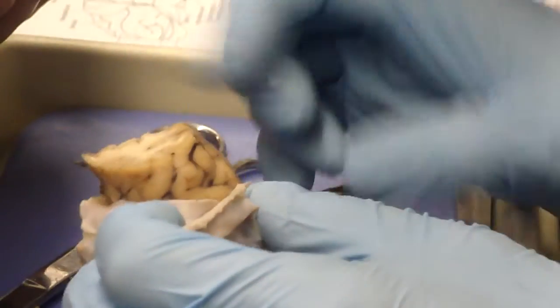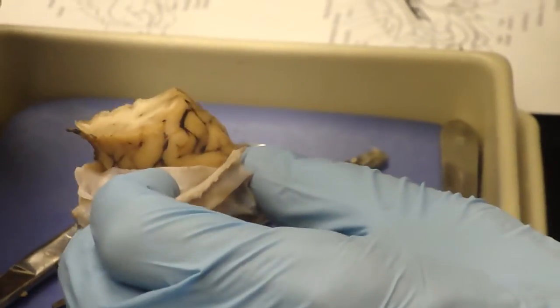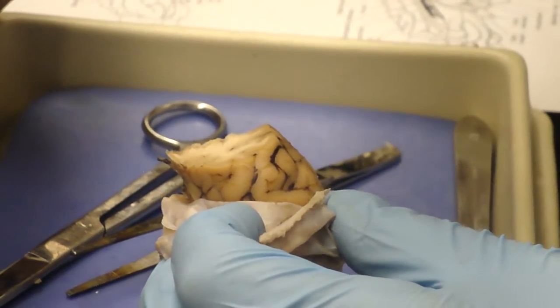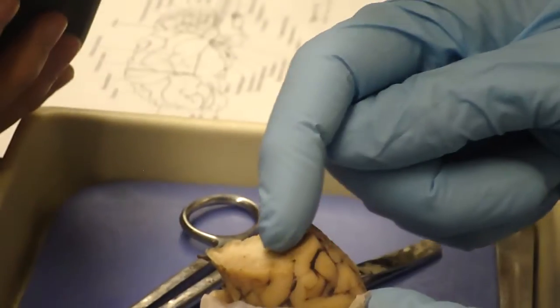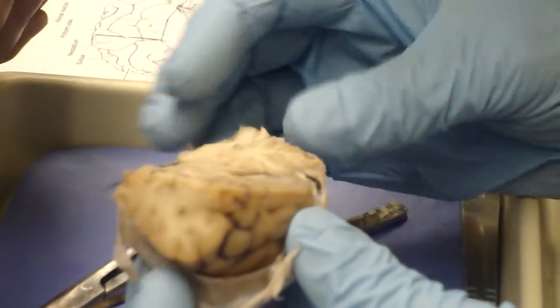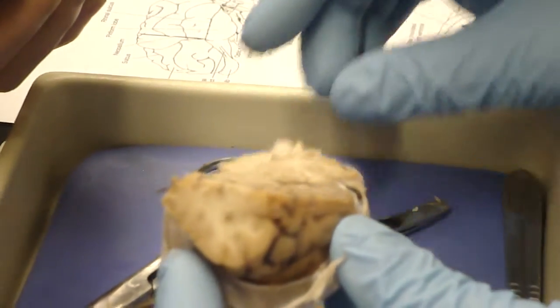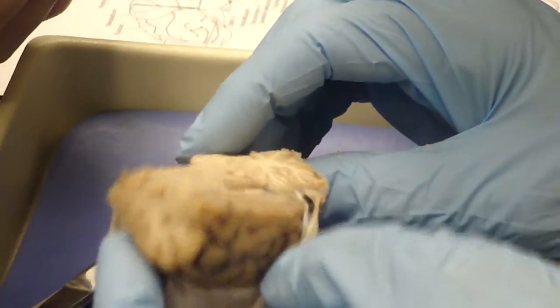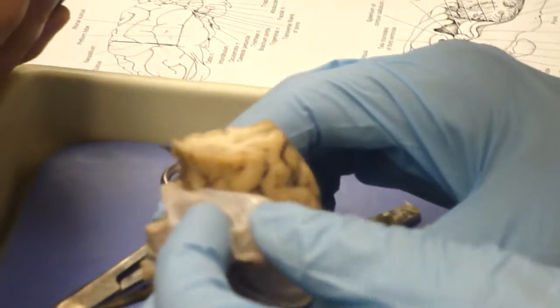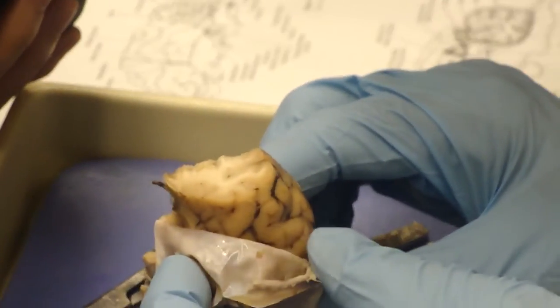And so the gray matter is really associating information from all different parts of the body, deciding what to do about it, and then sending instructions out through the white matter, generally down the various routes, but ultimately down the spinal cord, to have some sort of activity take place. So gray matter is associating information.